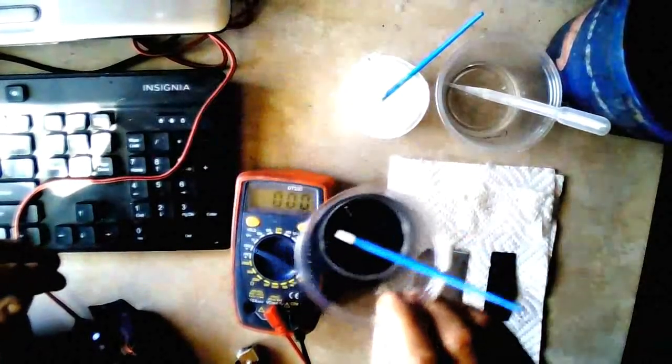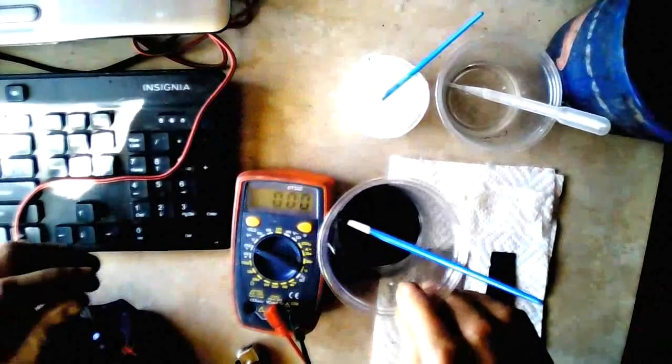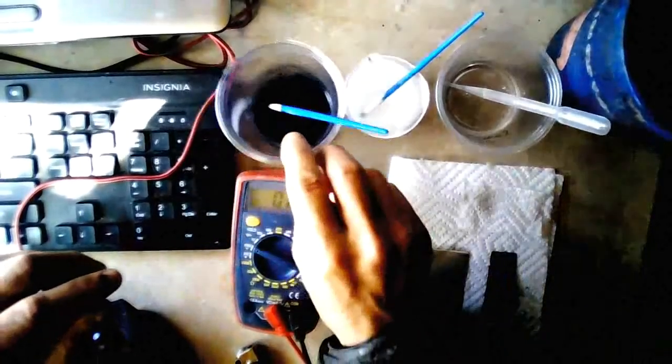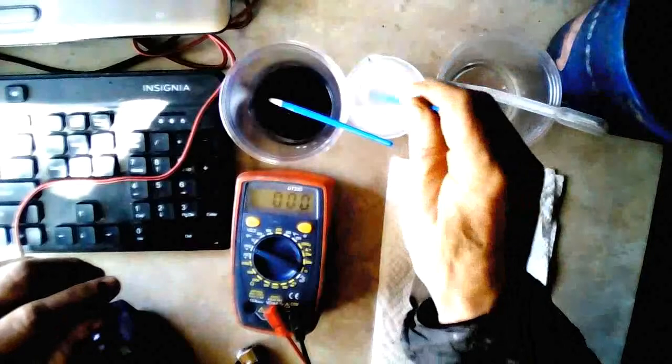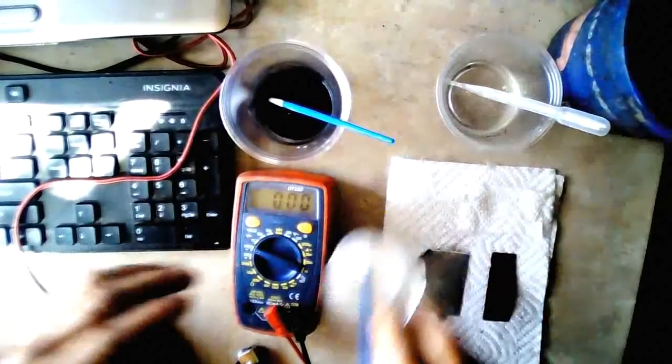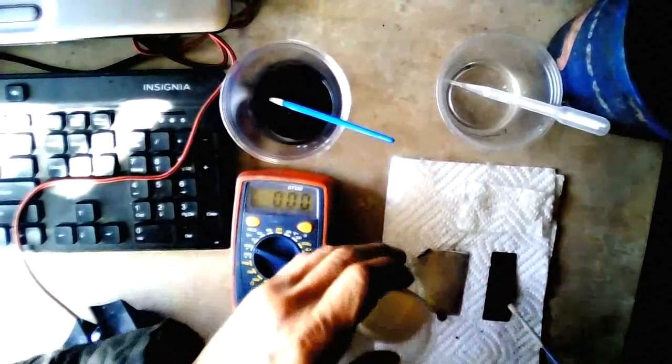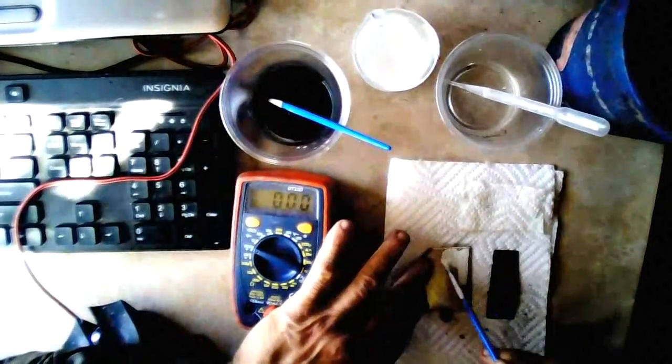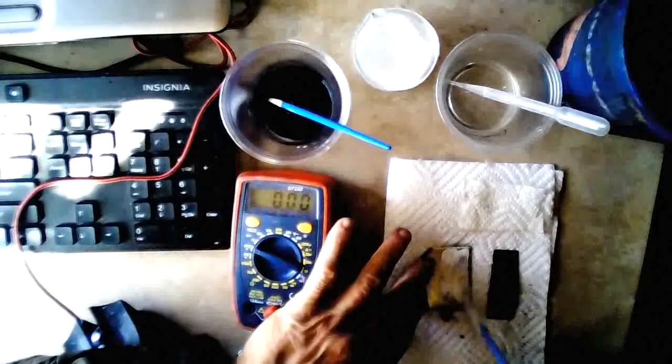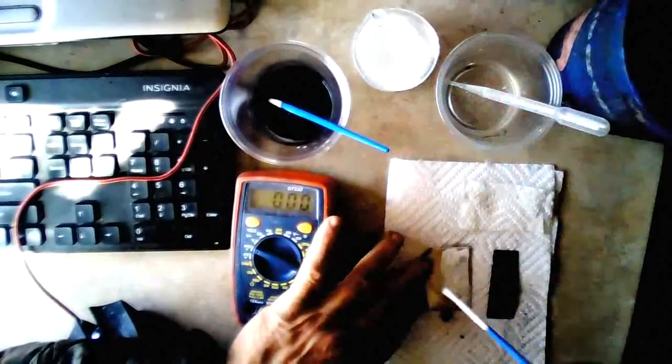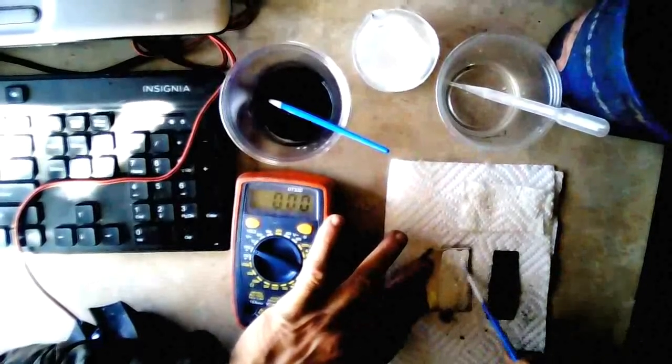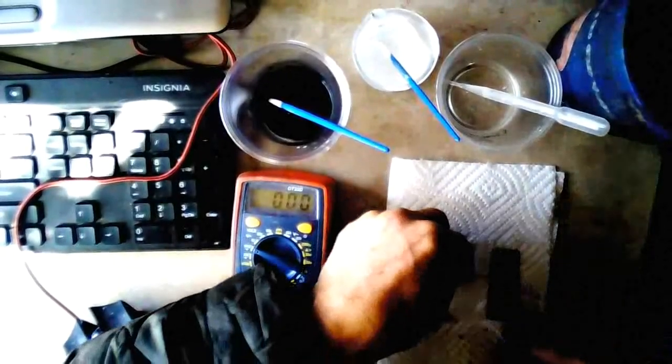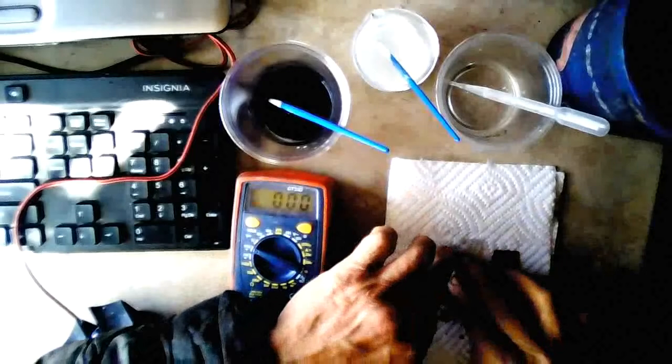So I've got another little batch of microspheres I've made here with some lecithin and water and graphite and urea mix. So this is our titanium dioxide and lime mixture for the negative electrode. So we'll paint a drop of that on here. Maybe two drops. And then we'll put our separator paper on.